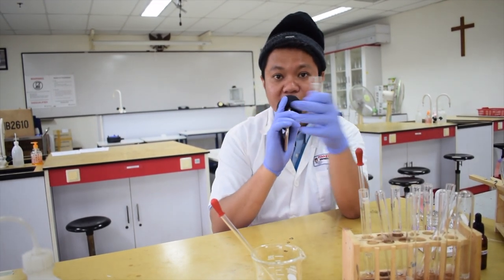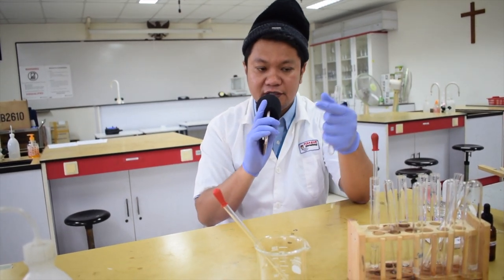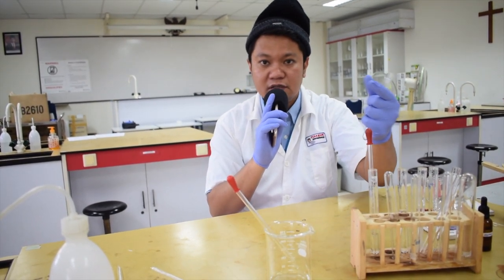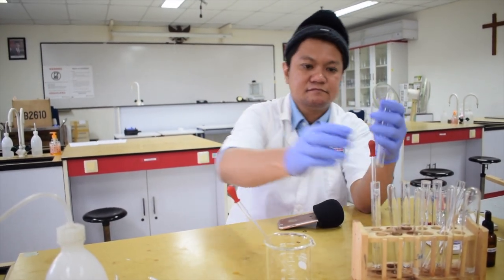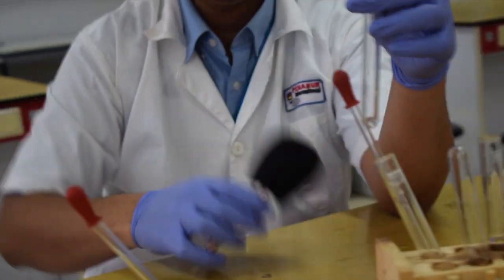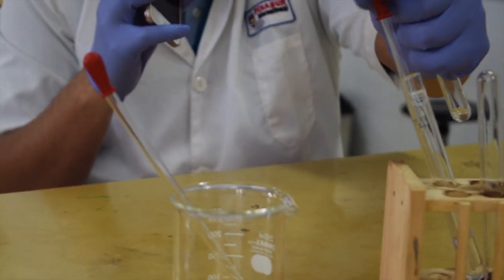The big question is how to get the samples — how many drops, and what is the quickest way to take samples? The quickest way is to use one squeeze of the pipette. If you want to measure 20 drops, that's okay too, as long as you do it consistently. I have one centimeter depth with approximately one squeeze of the pipette, and every time there is one centimeter depth required, I use one squeeze.